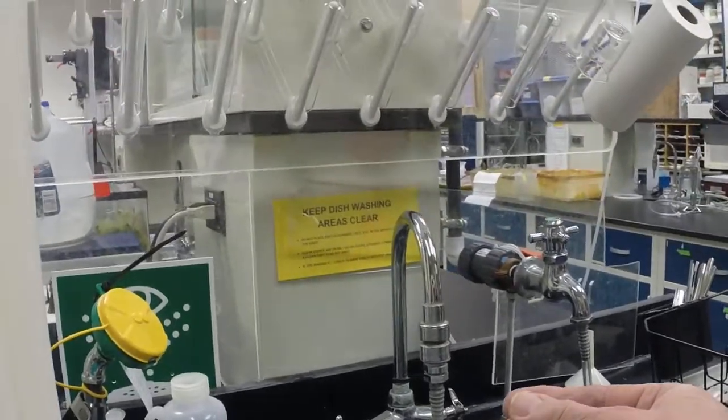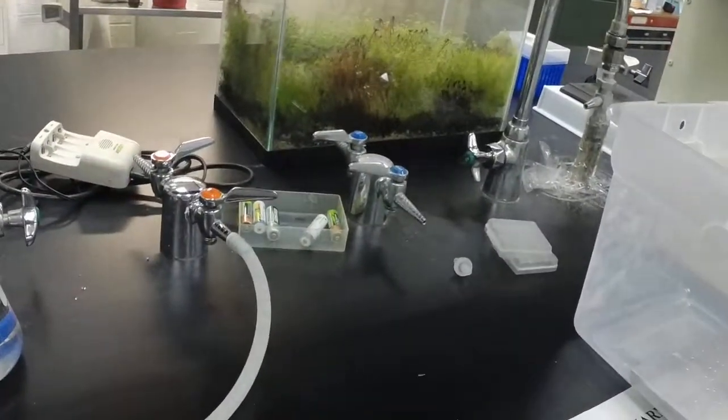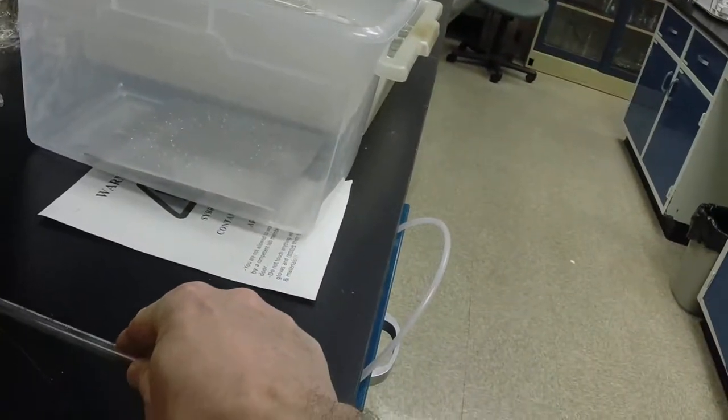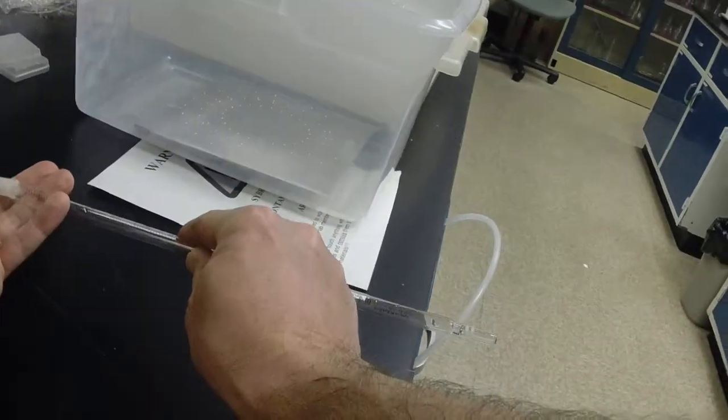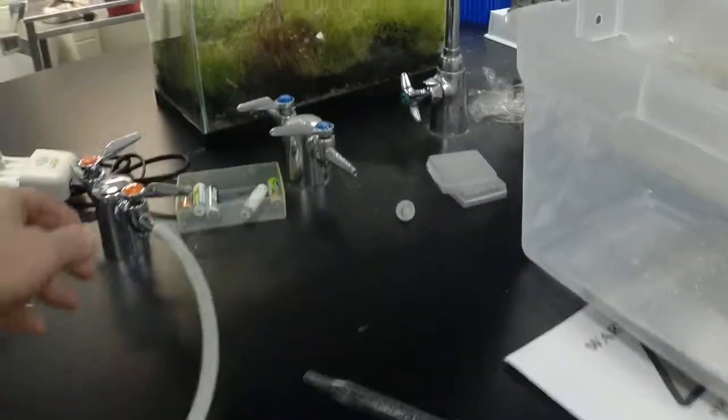In which case it may be necessary to shoot that out of there. The easiest way I found to do that is to get a little bit of air going, aim it at your least favorite lab mate, and it'll just pop that right out.